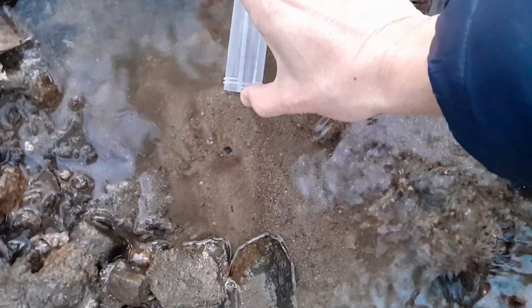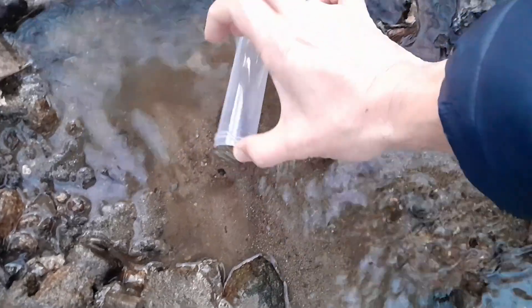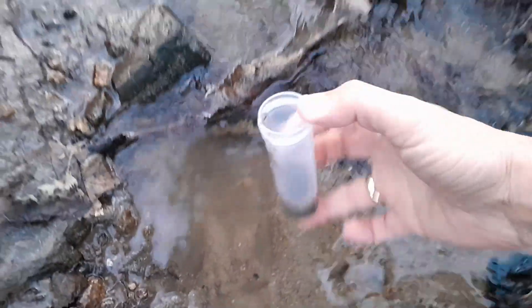So I'm going to take along a little bit of sand. Maybe there's going to be something interesting between the sand grains.